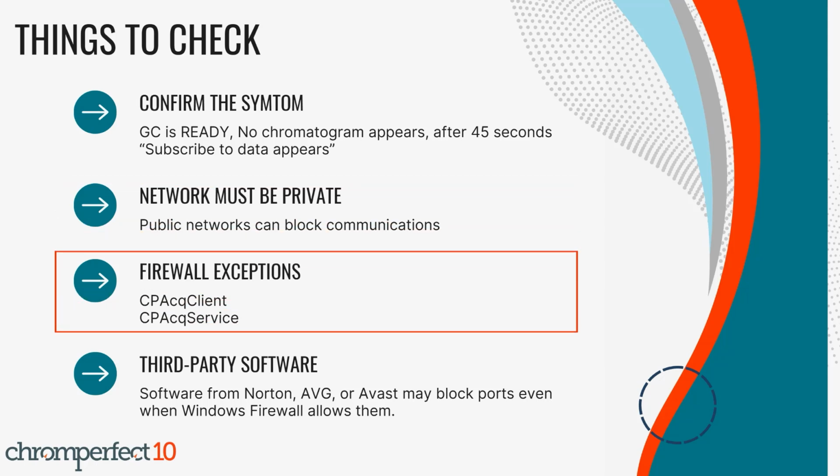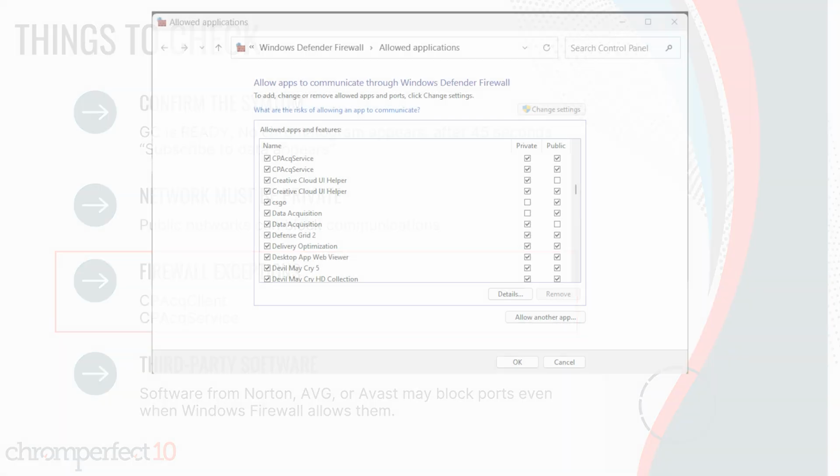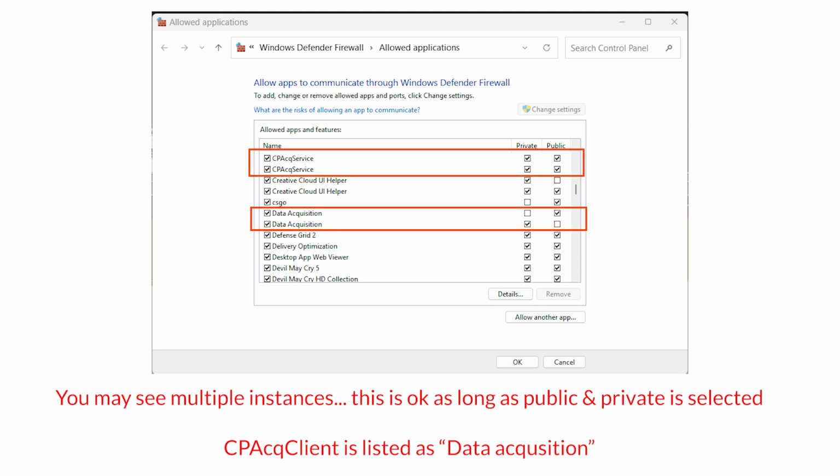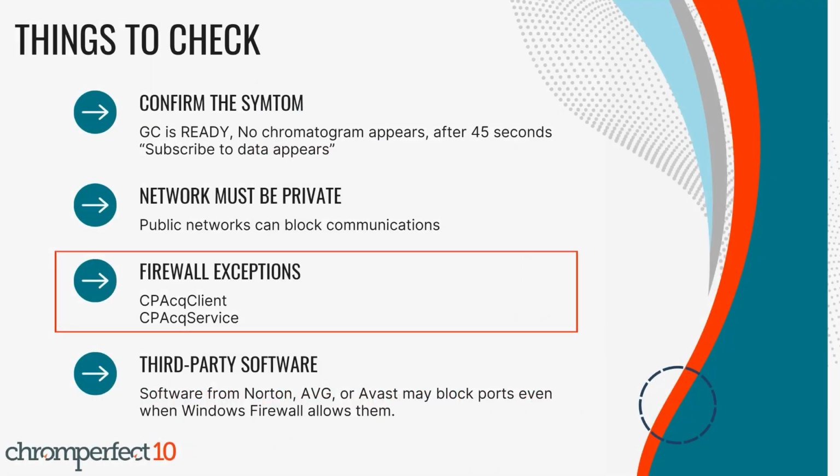Step 3: Allow the 2 required Chromperfect programs through Windows Firewall. These are the Acquisition Client and Acquisition Service. The file names are shown on screen now. Open Windows Security. Choose Firewall and Network Protection. Choose Allow an app through Firewall. Ensure both of these programs are allowed on private and on domain if present. If they are missing, choose Allow another app and browse to your Chromperfect installation folder to add them.